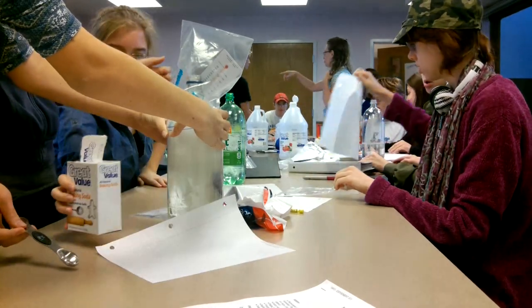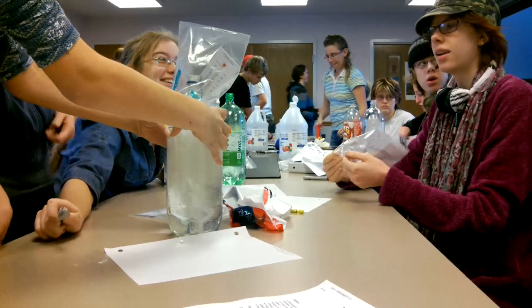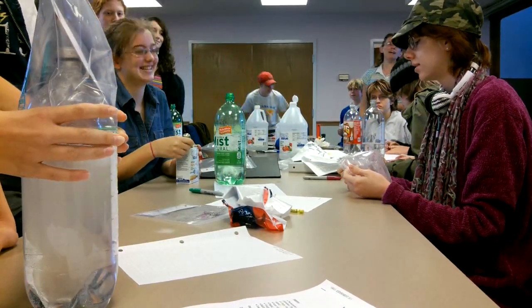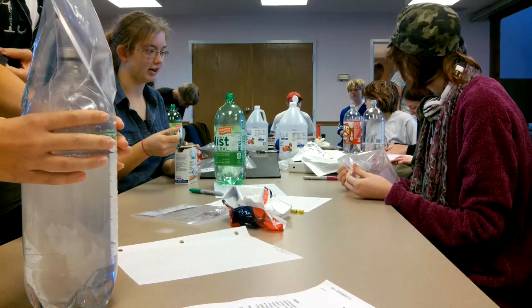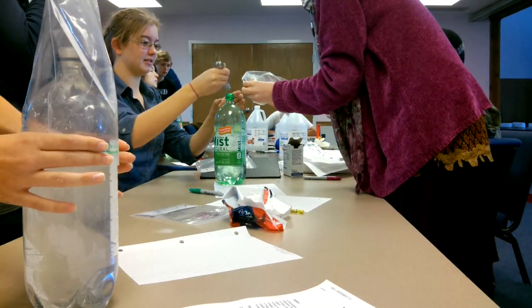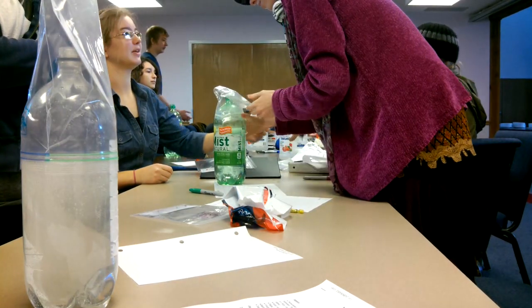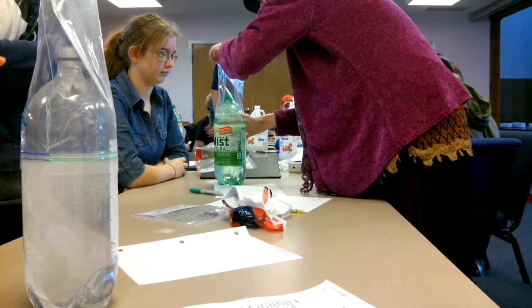The bottles can just go in the drain. It looks like it's about 65 degrees in there — that's what happens with the carbon dioxide bag getting warmer.